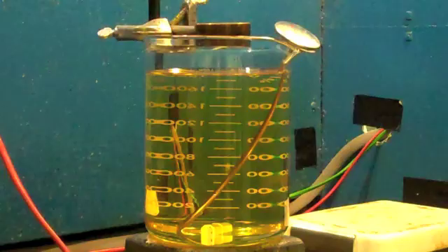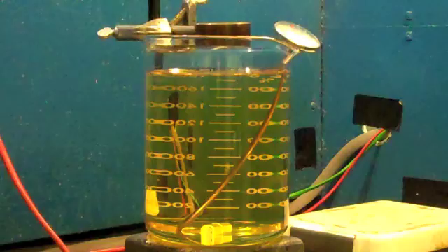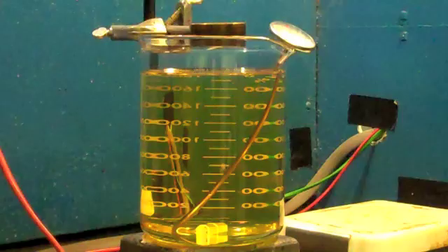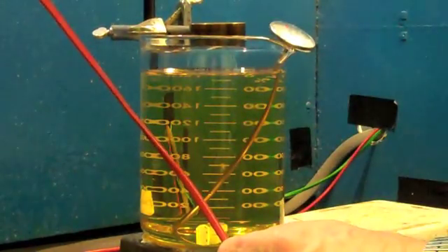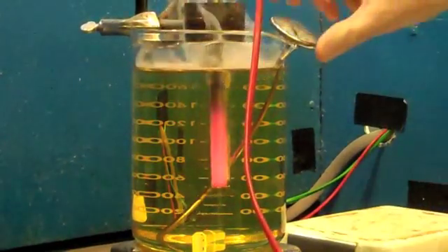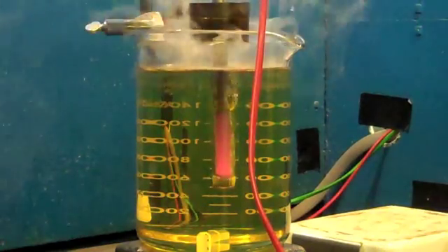We then, on our computer, hit the run test button to start acquiring data. Then, we transfer the probe as quickly as possible into the quench oil.